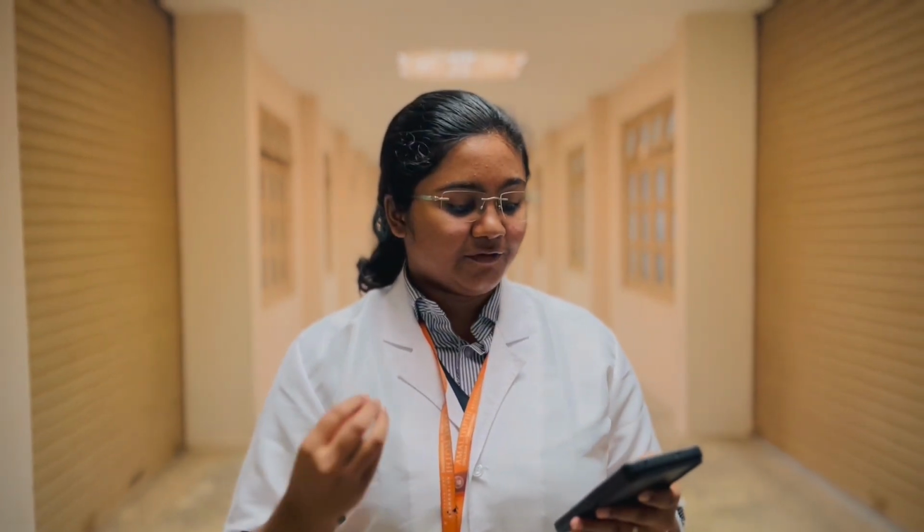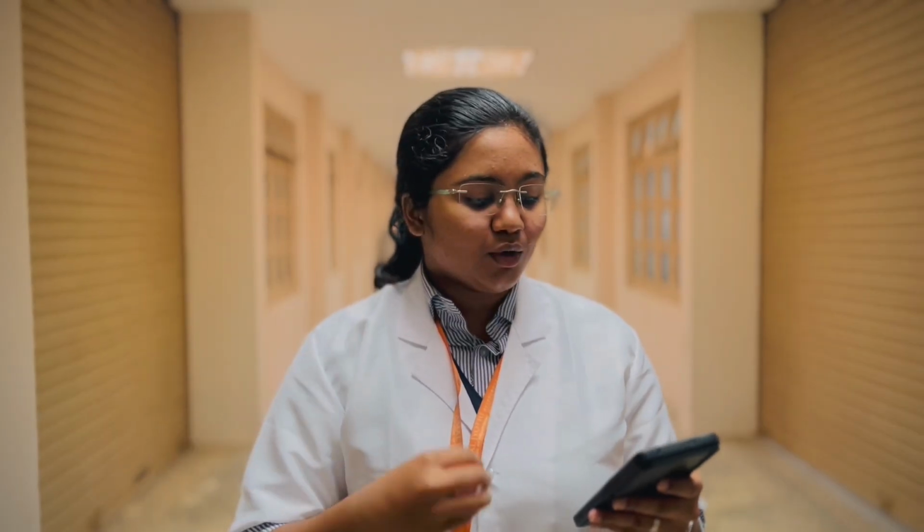Now I'm here to talk about safety measures for a coffee cup calorimeter. First, let's see what we have to wear during the lab. We have to wear safety goggles. They will protect our eyes during the experiment if there is any spill or discharge from the reactants we are using. Then we have to wear the lab coat and chemical resistant gloves. Also, shoes are necessary to keep us safe.